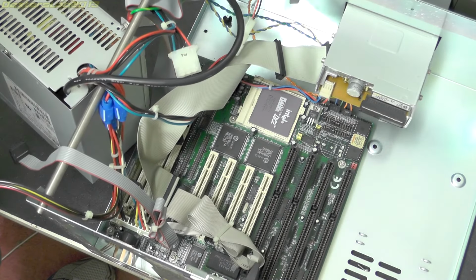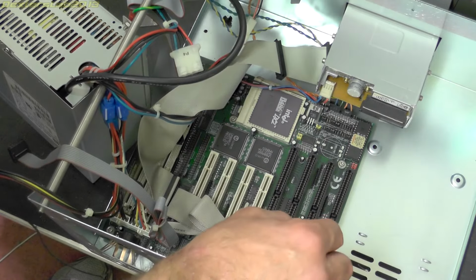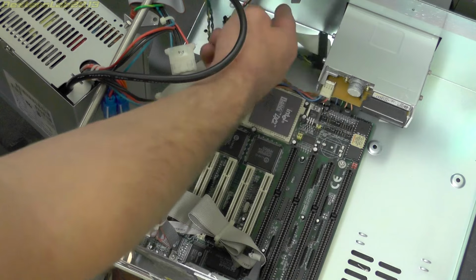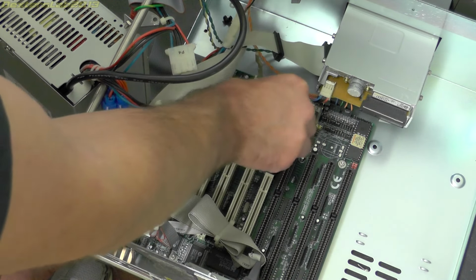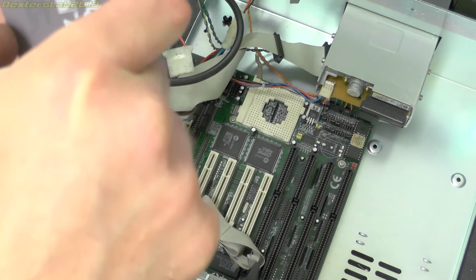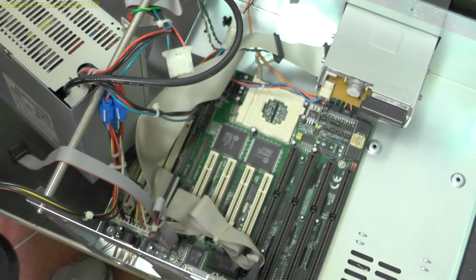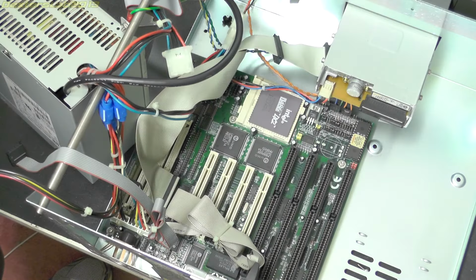So all the LCD display, motor controls, that's all done in that black box that I've just removed. So it doesn't look like the PC was really doing much at all. So yeah, we've got floppy disk cable there, and the old 486 DX2, and it is a 66 megahertz version.